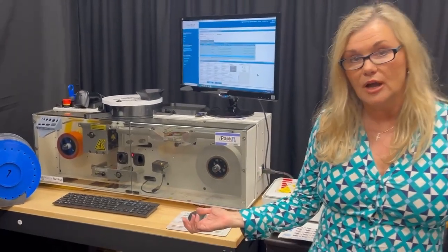The advantage to this system is that you are able to run one drug database. You will house all of your users in one system, you will have all of your templates in one system, all of your templates will be categorized by type of output, and they will also be secure. You can maintain consistency across your entire pharmacy in how you manage packaging drugs, how you manage labeling drugs, and what information is on those templates.